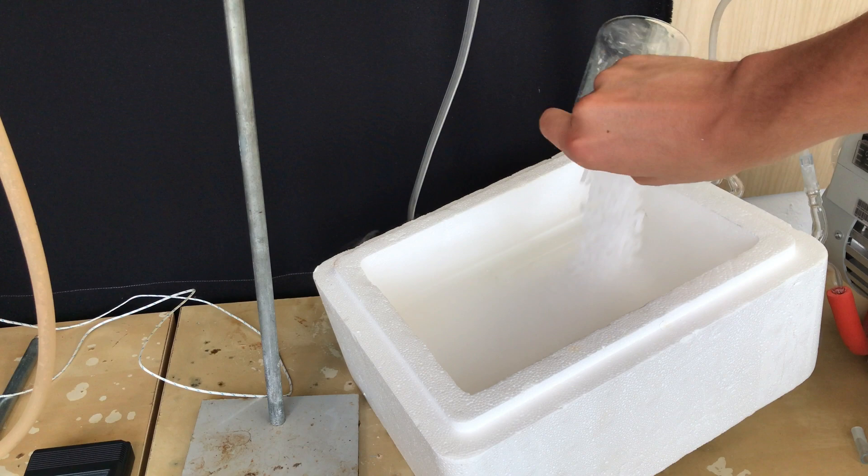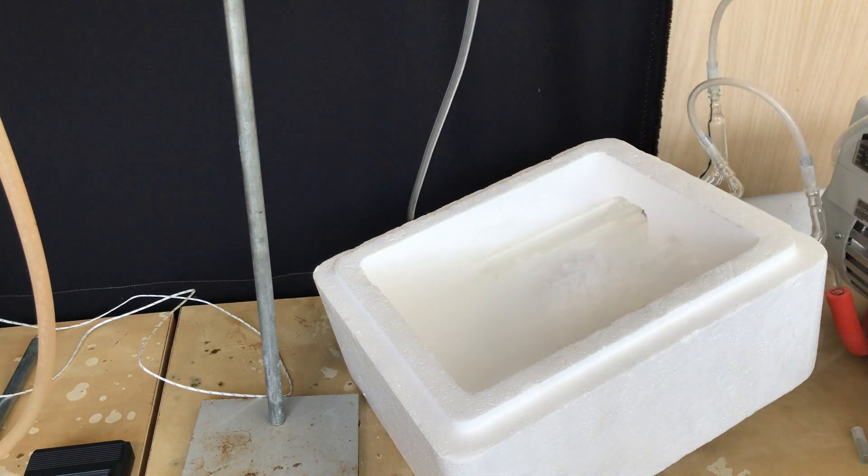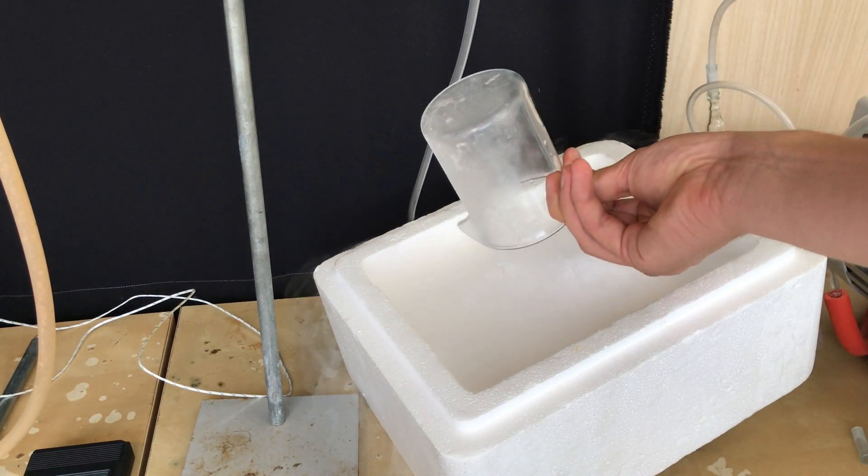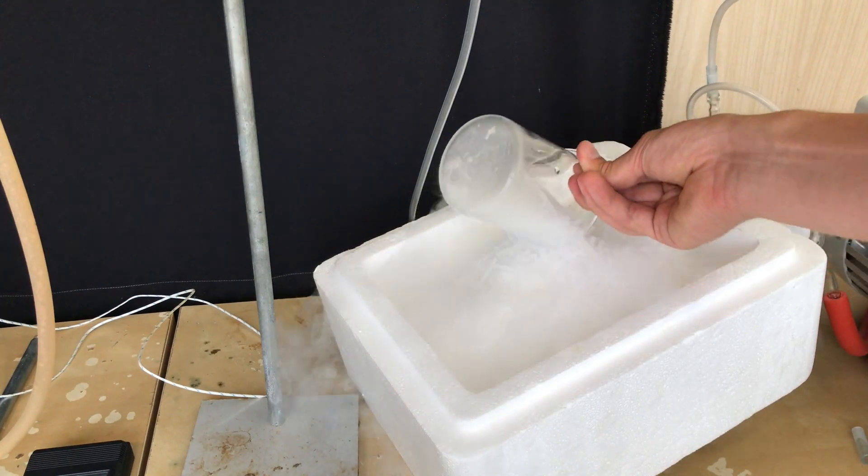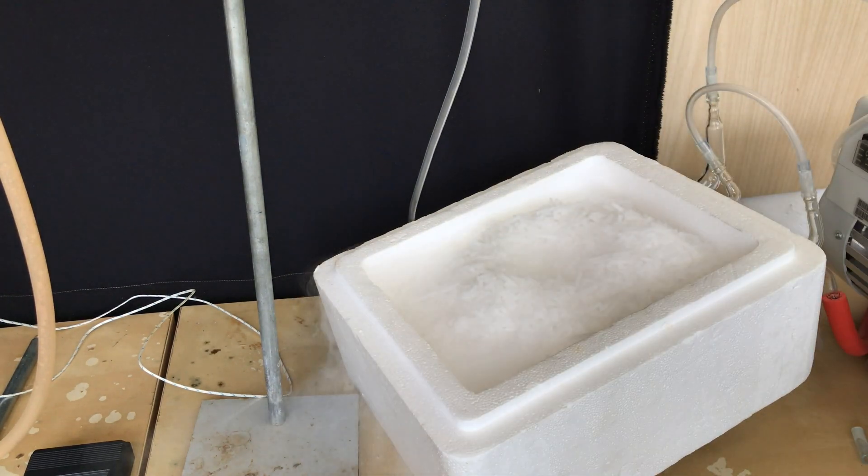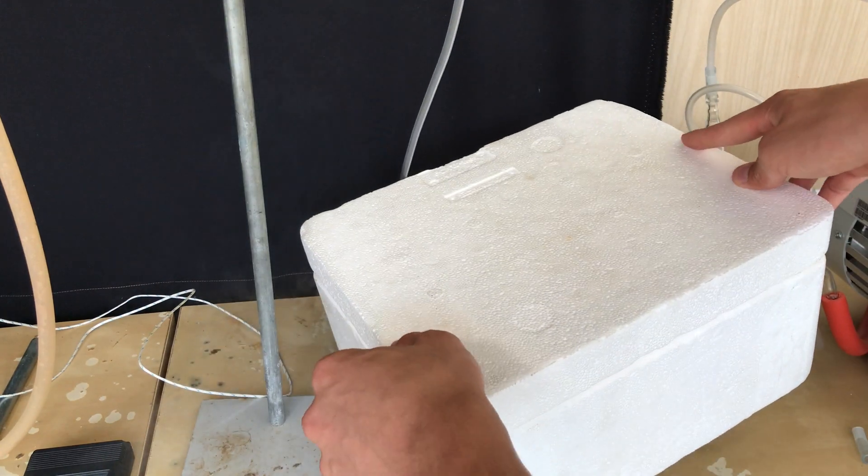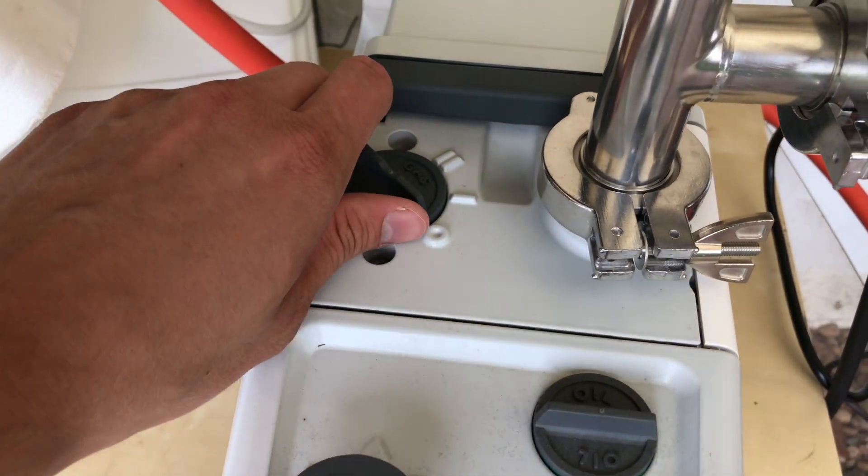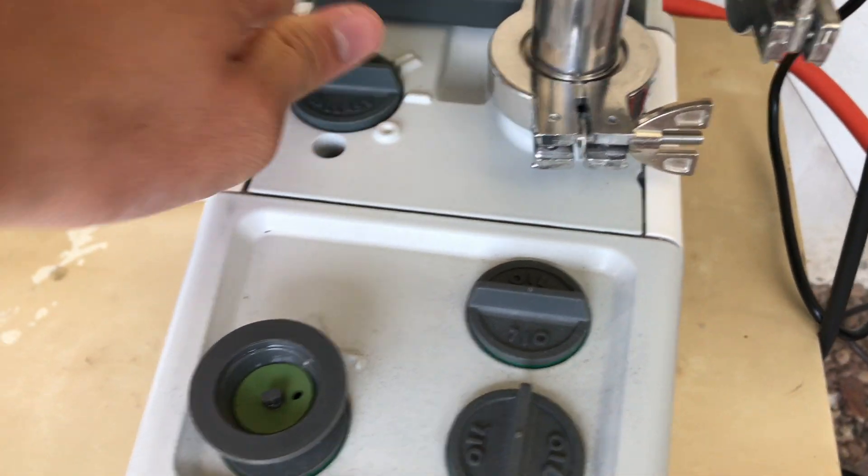I do not want to mess up my good vacuum pump with solvent vapors. For this reason I connected three cold traps in series using PVC tube, fit them into this styrofoam box and filled it up using dry ice.